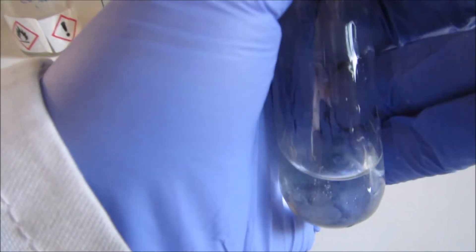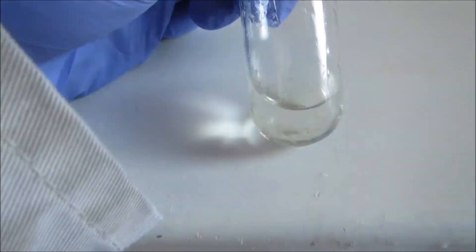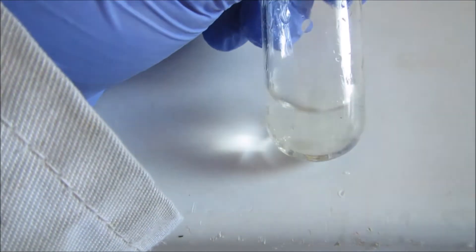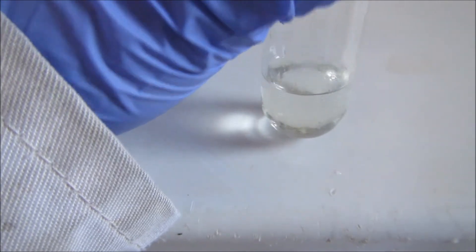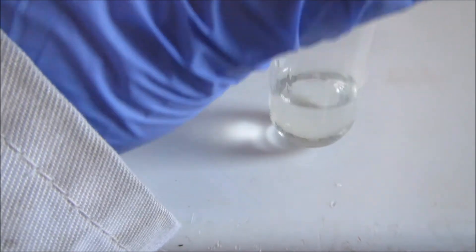To the next one — it's our olive oil. If I give it a shake, hopefully you can see there are little globules of fat that have formed. It might be quite hard to see on camera, but as I rock it back and forth, there are globules. This shows that there's fat in the olive oil.